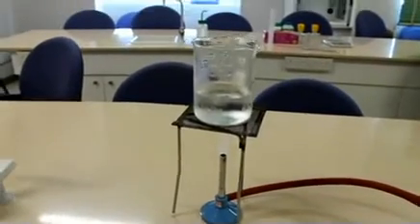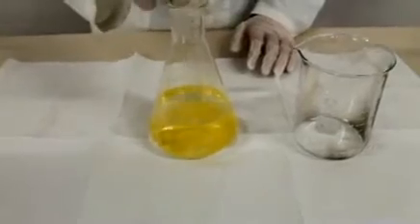Some distilled water is boiled on a Bunsen burner flame. The boiling water is then poured into the conical flask containing lead iodide. The precipitate needs to be dissolved and recrystallized in order to obtain large crystals of lead iodide. The solution is stirred with a glass rod until all the yellow precipitate is dissolved completely.